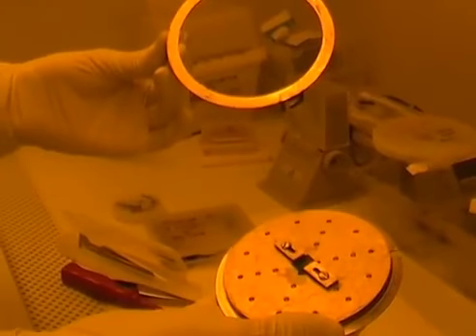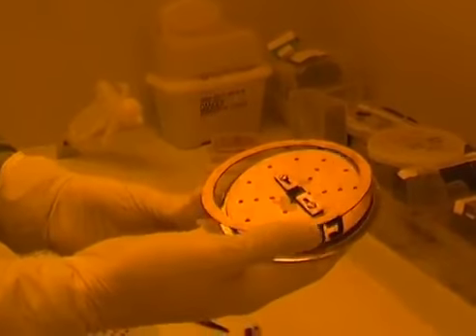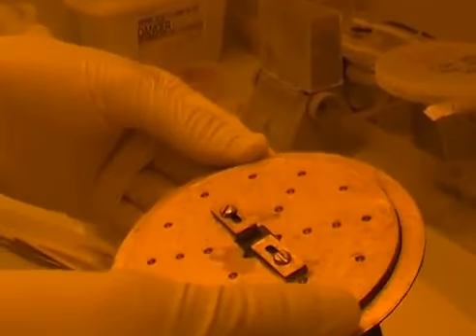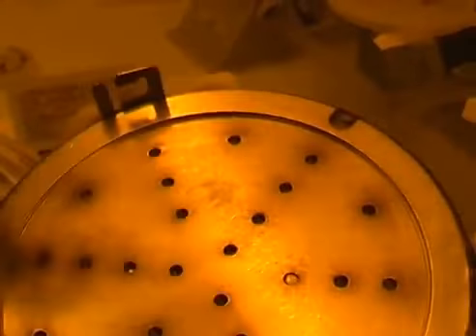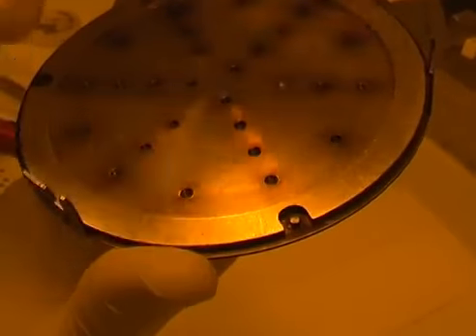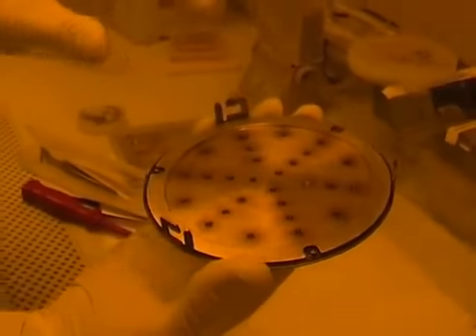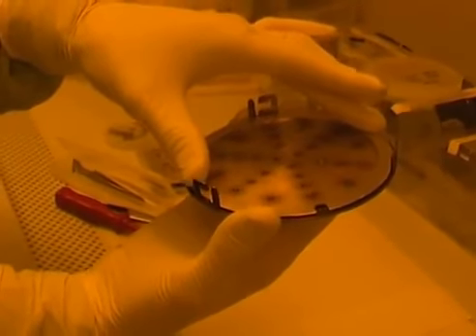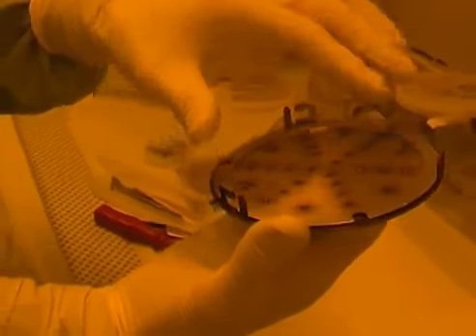So once the sample is in place, I need to place the sample holder onto this screen here. In order to do that, I have to put down this sort of screen this way, and then I need to make sure that on the other side the 3 notches that I find on the screen are aligned with the notches in the sample holder, so that the sample holder cannot freely rotate inside the screen.